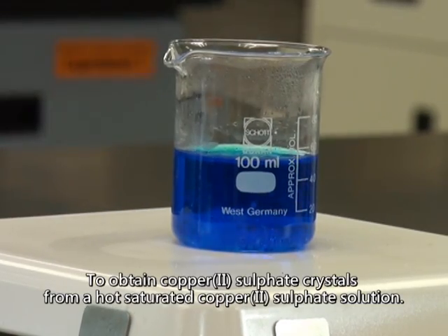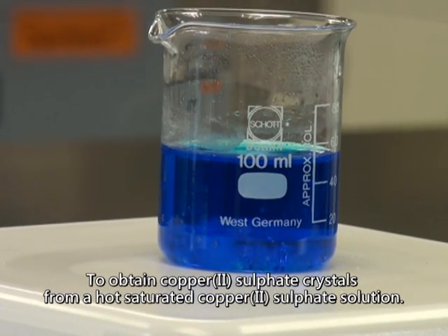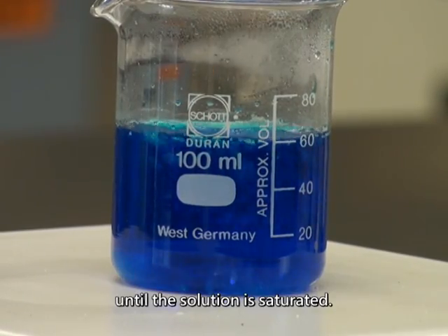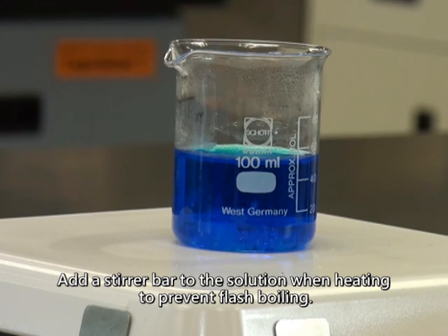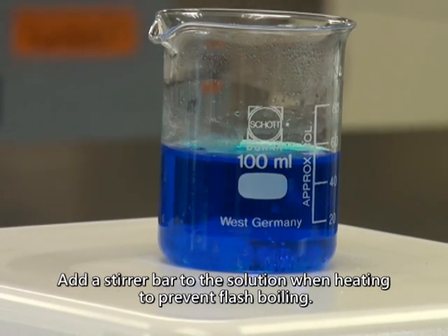To obtain copper-2 sulfate crystals from a hot saturated copper-2 sulfate solution, heat the copper-2 sulfate solution to boiling and evaporate the solvent until the solution is saturated. Add a stirrer bar to the solution when heating to prevent flash boiling.